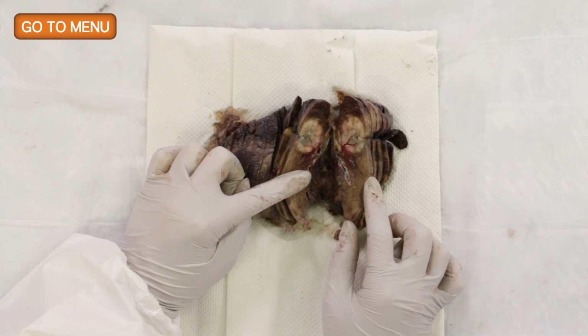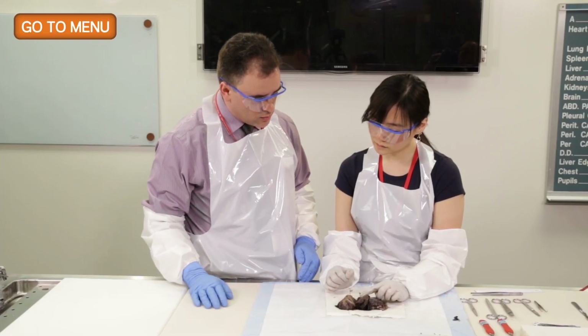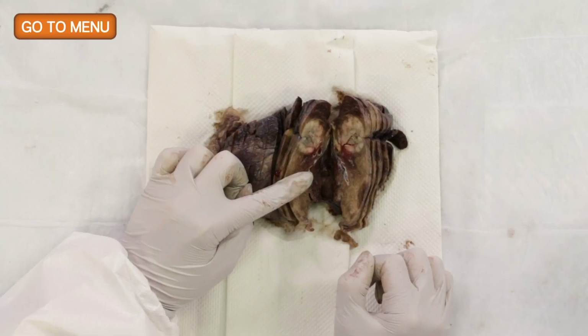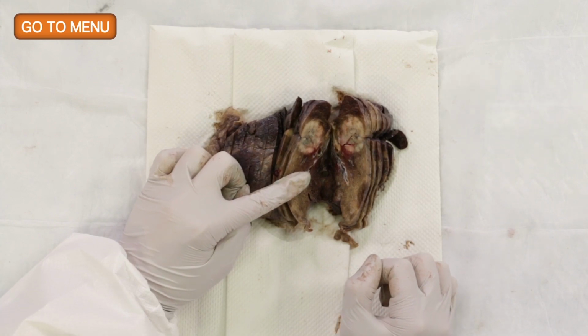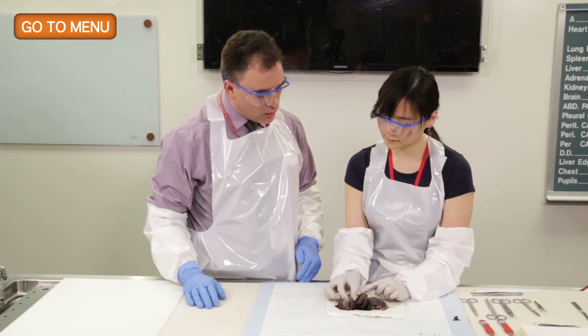That depressed center is very typical of adenocarcinomas in that the fibrosis that occurs in the center of the tumor causes retraction, and that retraction causes that depression. That appearance we often call umbilicated, and the umbilicated appearance is quite characteristic of adenocarcinomas, although certainly not entirely specific for it. In terms of feeling it, does it feel firm? Does it feel like lung parenchyma?